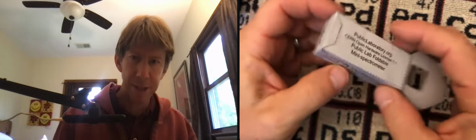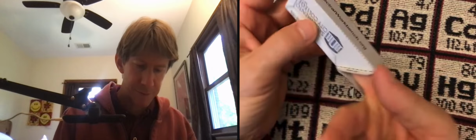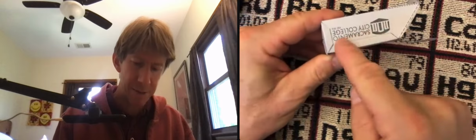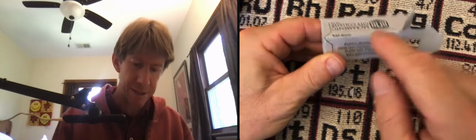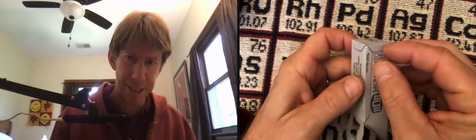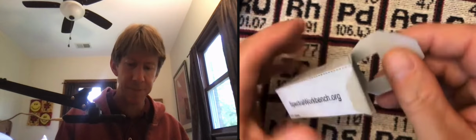And so now I'm going to go in here and do that to all this tape. So I've got a piece of tape here keeping this box closed, and I've got three pieces of tape, one for each of these three sides. Good. It's starting to take shape.